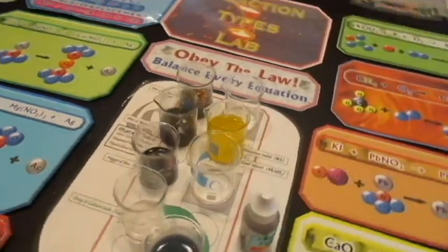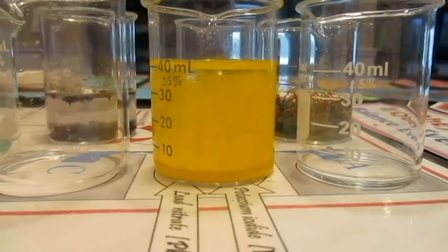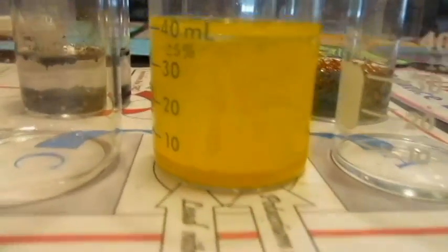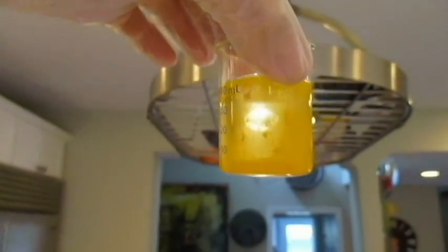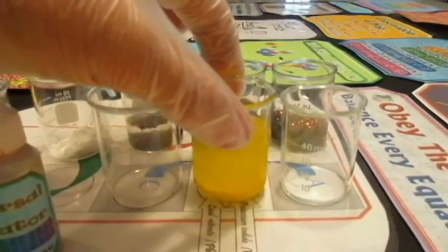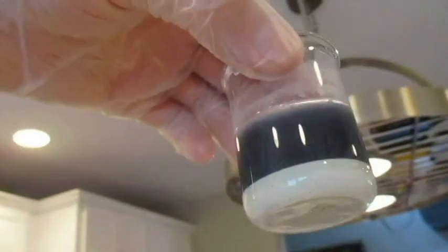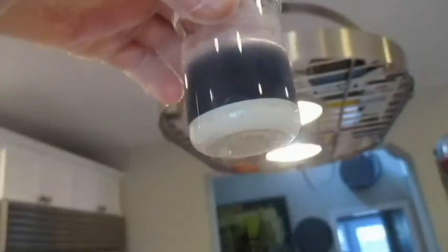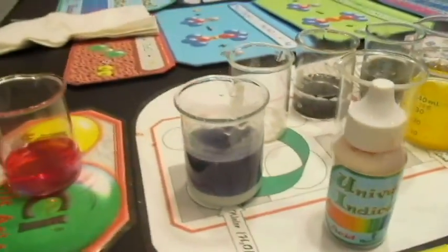And let's take another look at these beakers now. I see a lot of stuff down there. Can you see that? Maybe I should pick it up and hold it upwards. Notice if I shine the light through it, the light shines through some of that, but on the bottom we see what is called a precipitate. Okay, so that's one thing. What about this one? Well, same situation. Look, there's clearly powder on the bottom. Okay, and then the rest of it, of course, is that dark purple color.